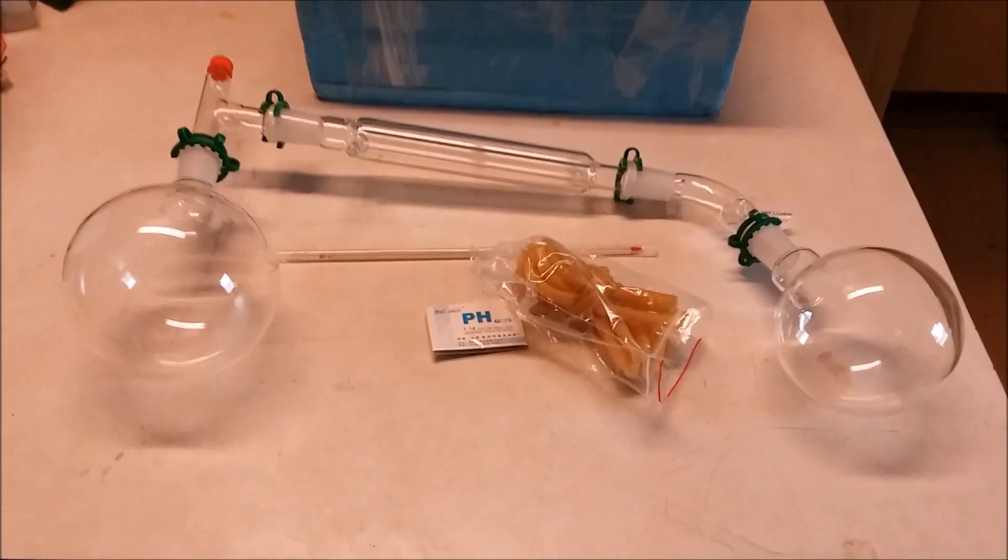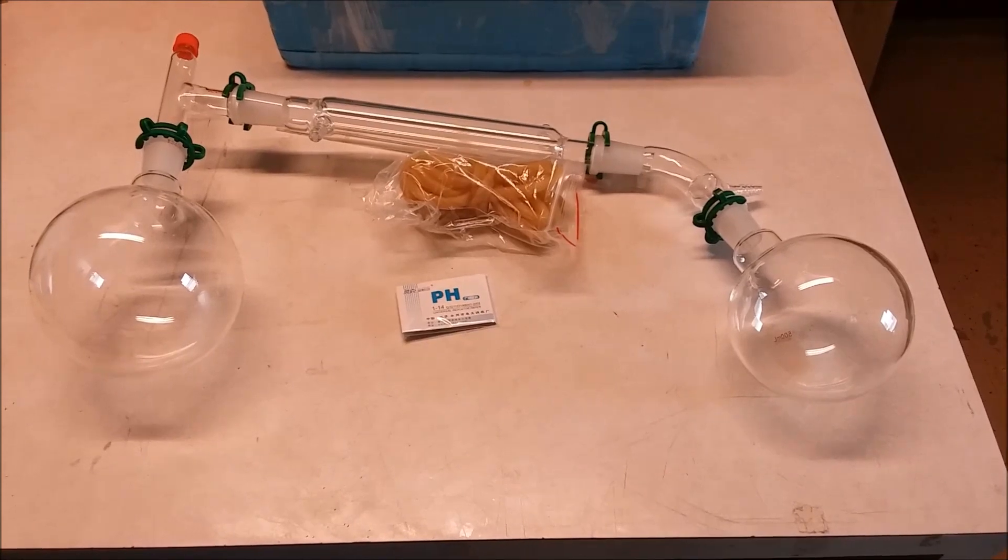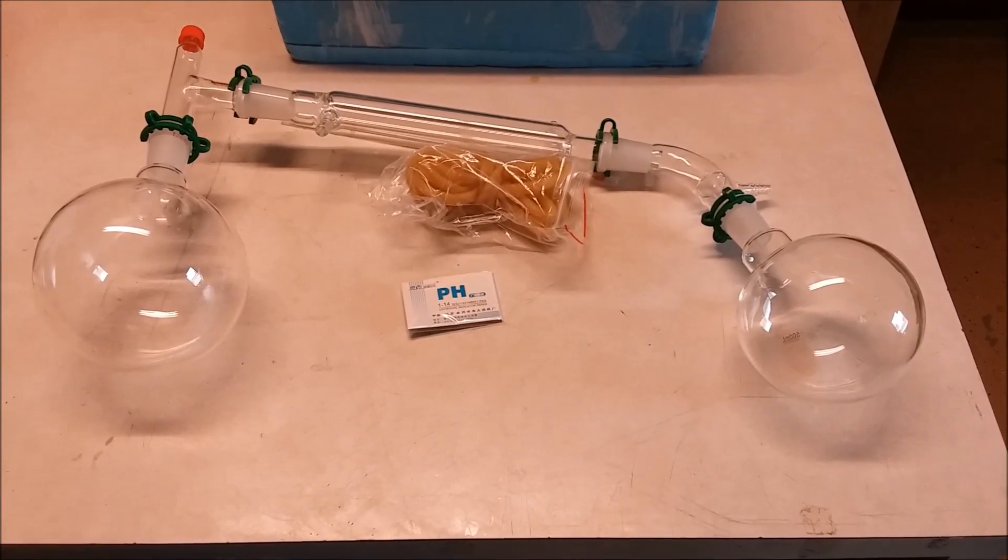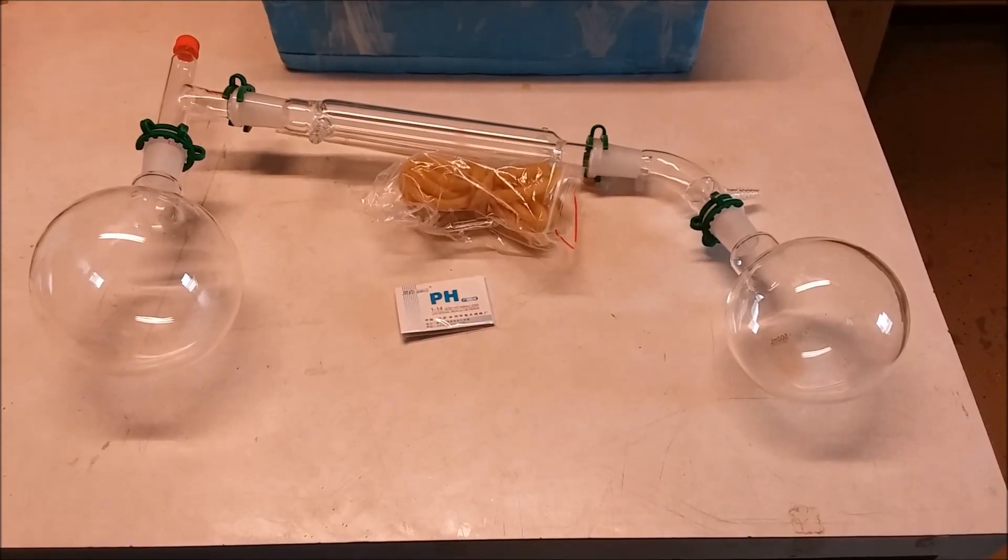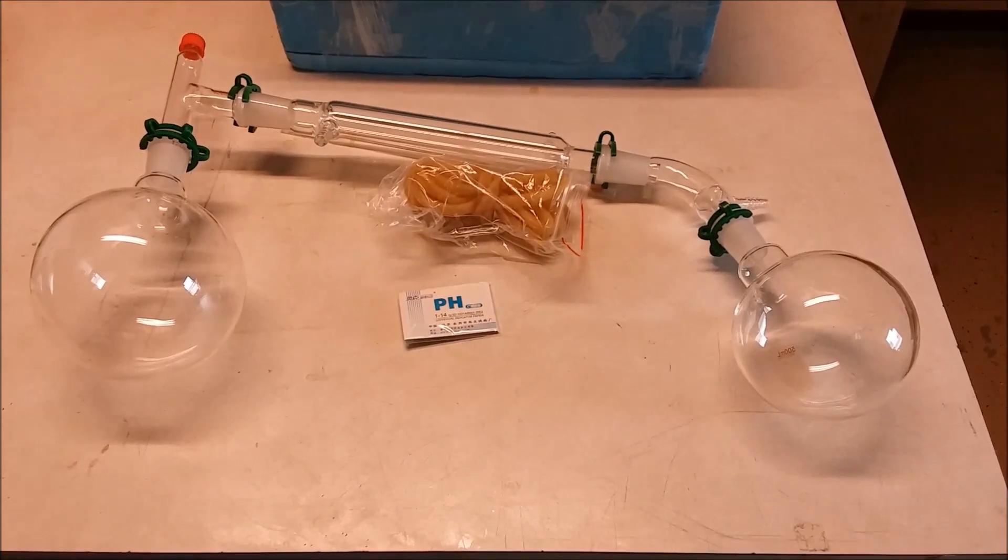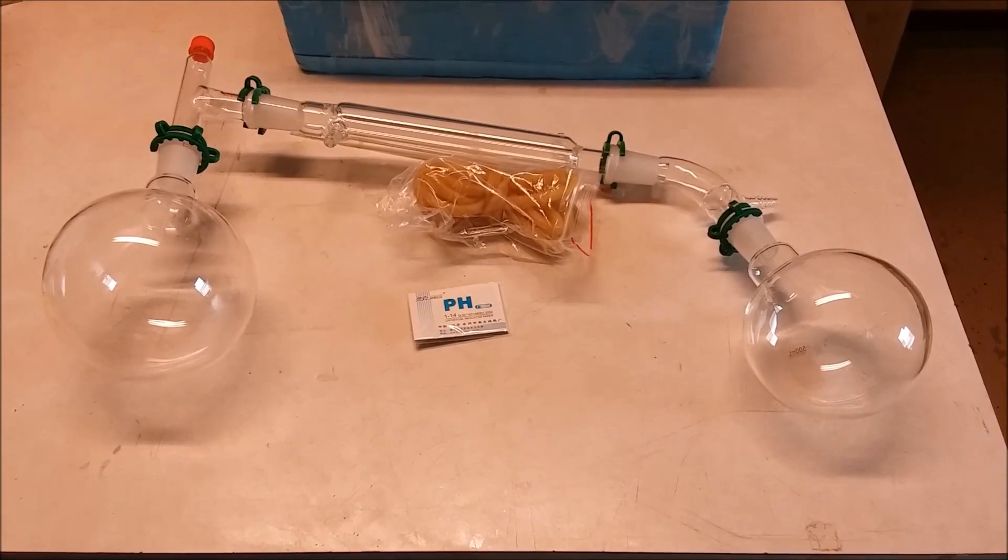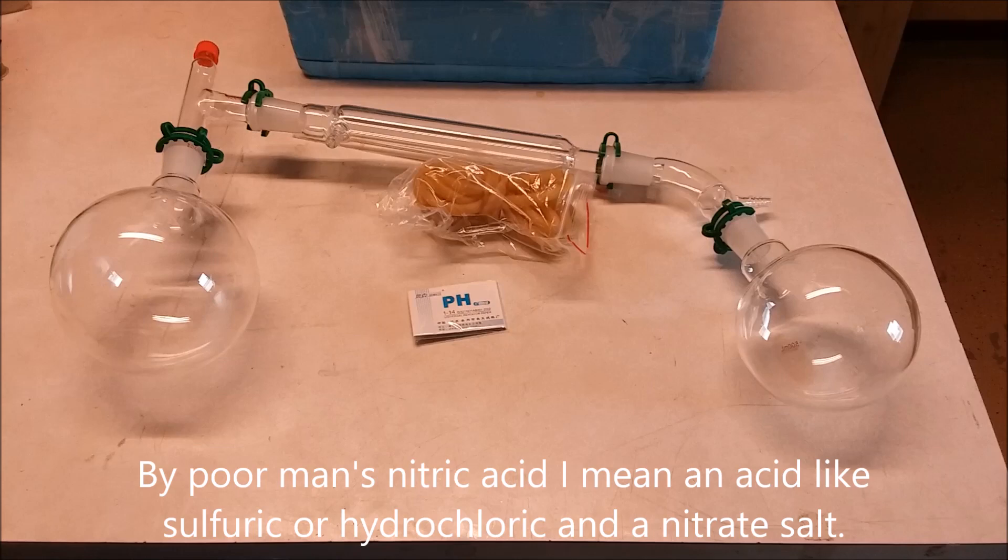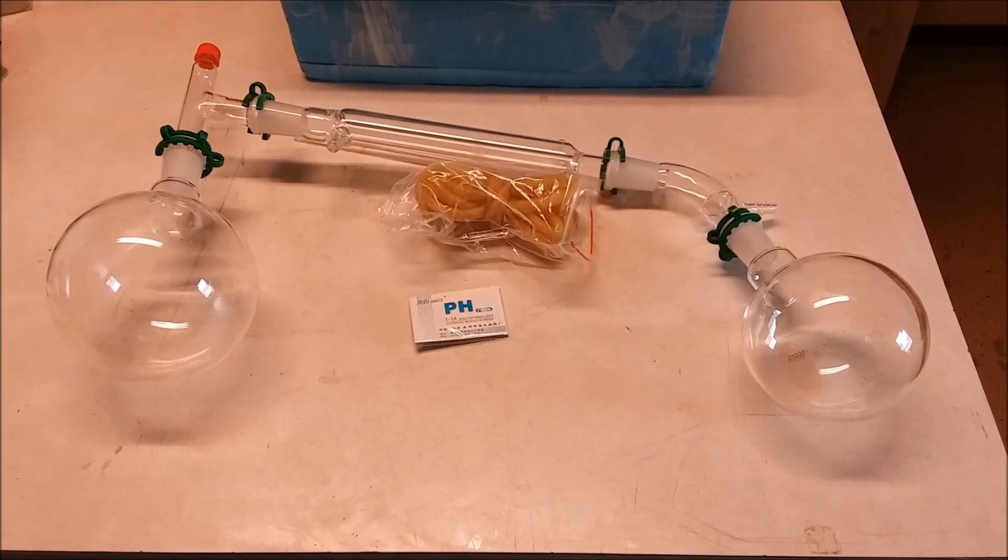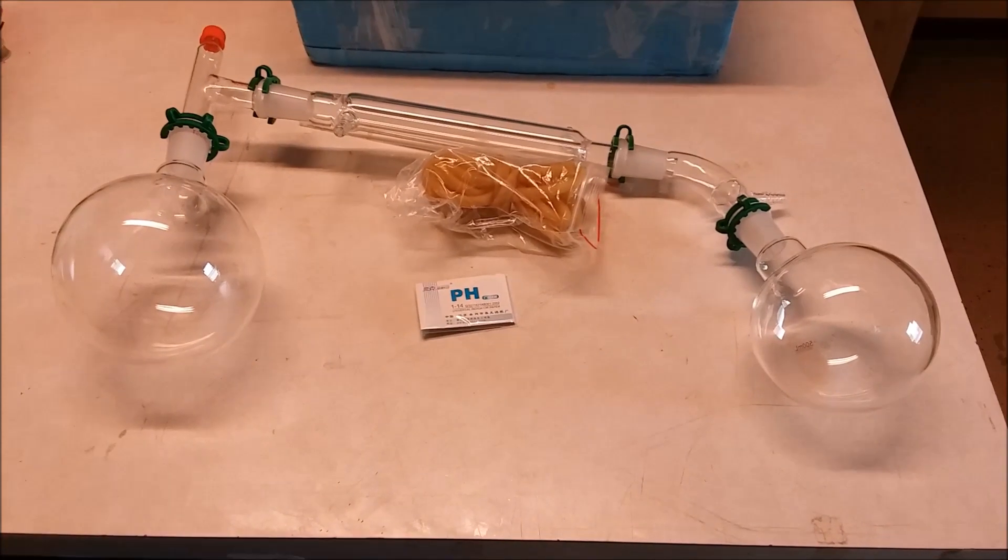With this distillation apparatus I can make as much concentrated nitric acid as I want. There's really no substitute for nitric acid for some things. I'm trying to dissolve some gold right now outside in some poor man's aqua regia and it is taking the age of the universe to work. With real nitric acid, you can dissolve silver, whereas if you try poor man's nitric acid with sulfuric acid or hydrochloric acid, you're going to be making insoluble silver compounds.